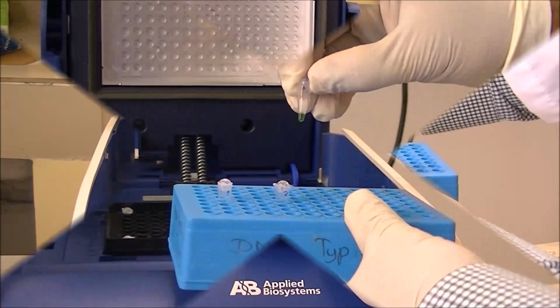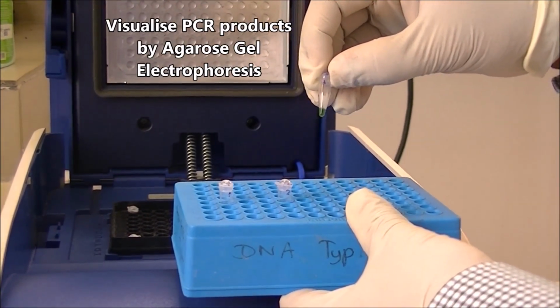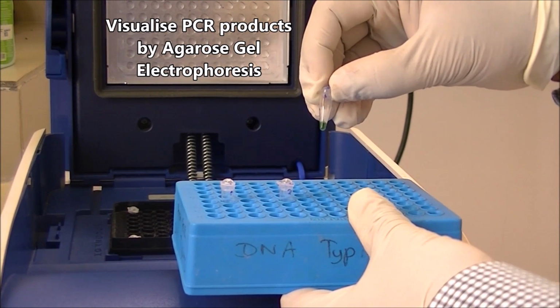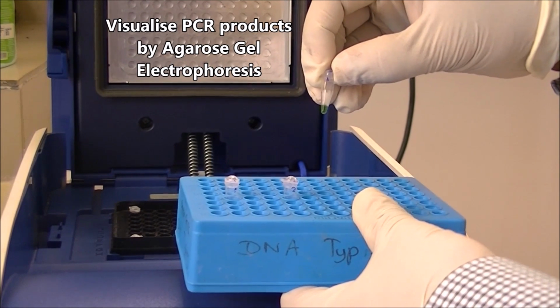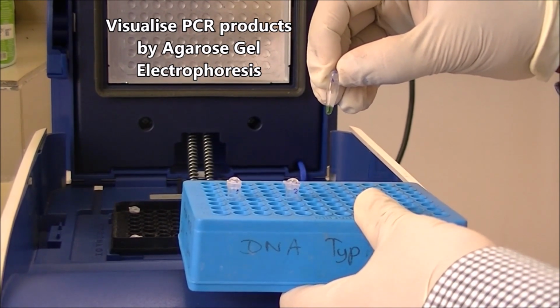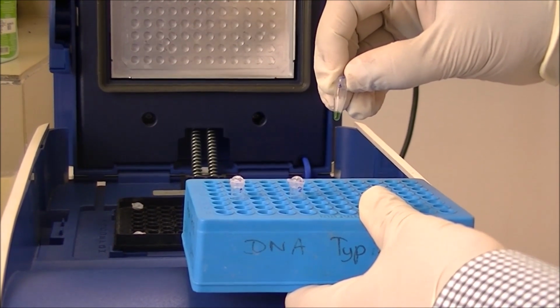In order to visualize whether we have obtained any amplification or not, we need to run these samples in an agarose gel by using the agarose gel electrophoresis procedure.